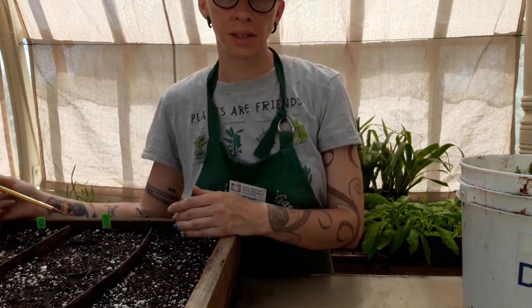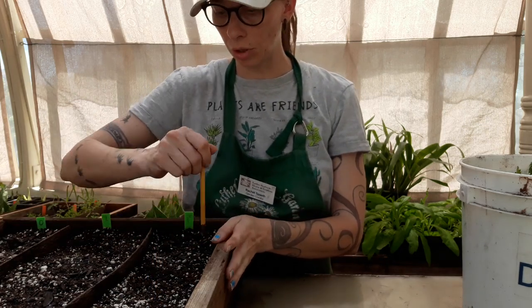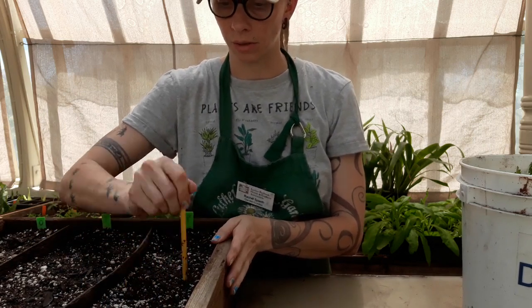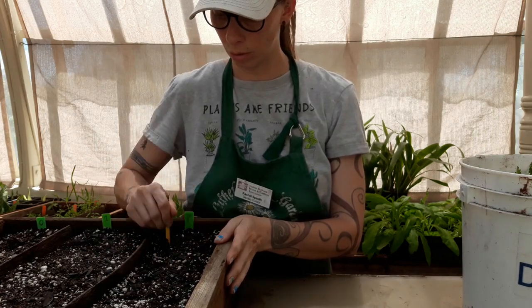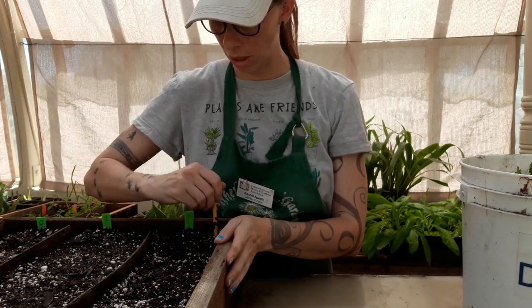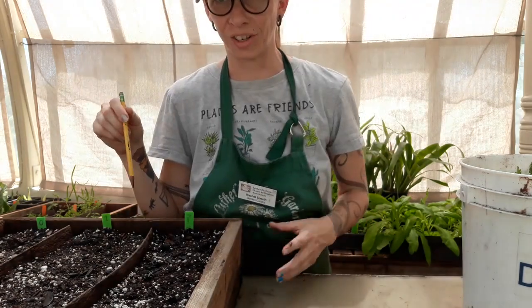We're going to do 20 cuttings of each for statistical significance. So I'll drill 20 holes in a row — 1 through 20 — for the first treatment.